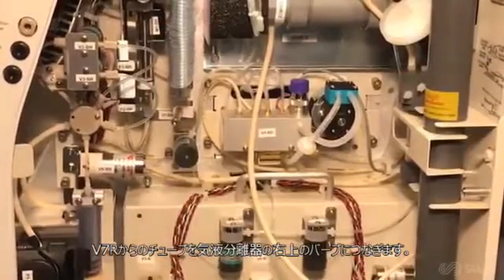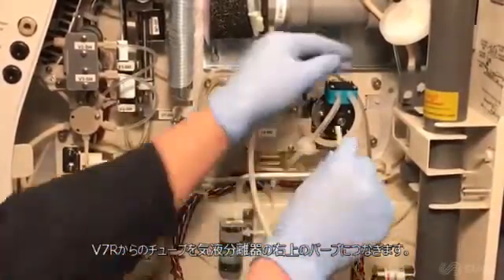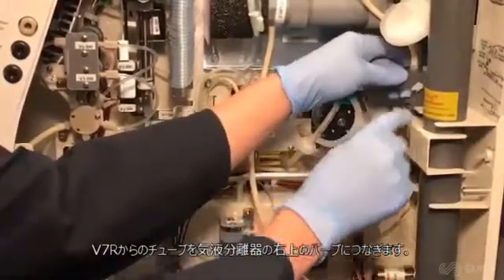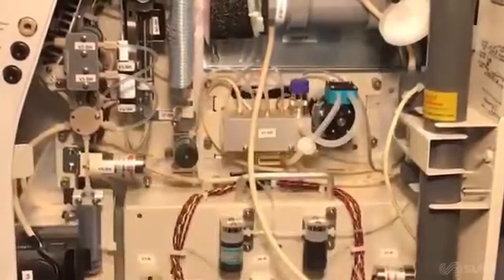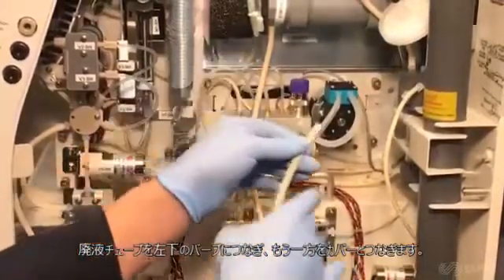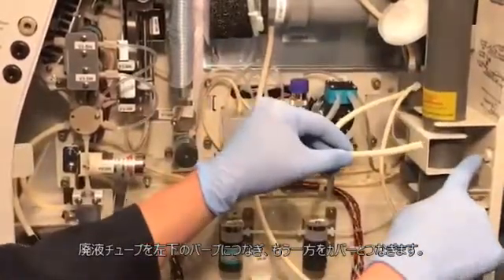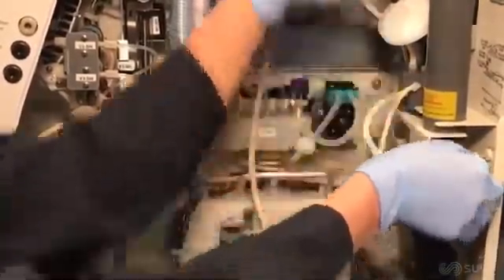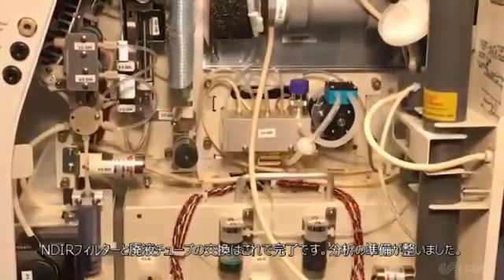Reconnect the pinch tubing extending from V7R and the waste tubing to the front of the gas liquid separator. The section of tubing extending from V7R should be connected to the upper right barb. The waste tubing should be connected to the lower left barb. Reinstall the fluidics cover. NDIR filter and waste tubing replacement is now complete and the system is ready for analysis.